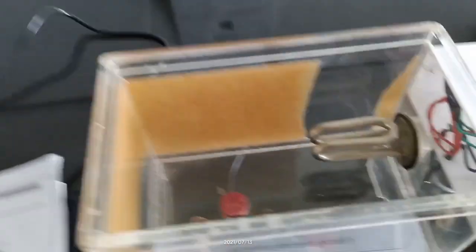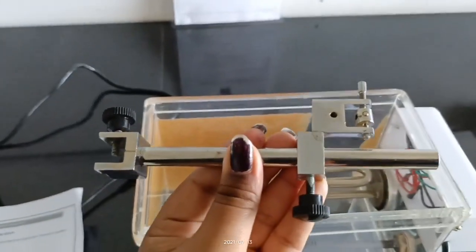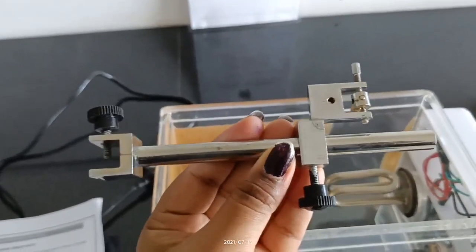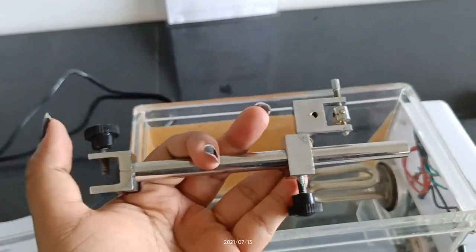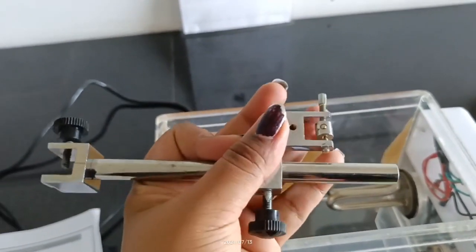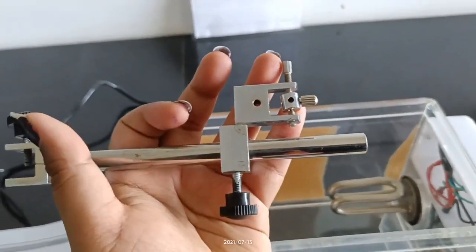The next part is the lever holder. The lever holder has a screw and you can use it to secure parts in position.